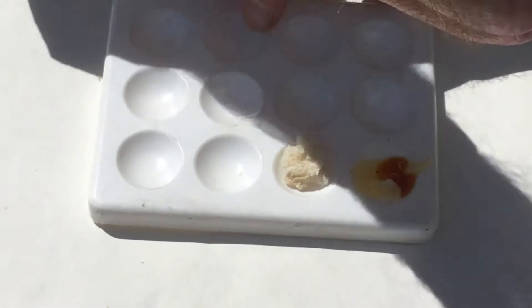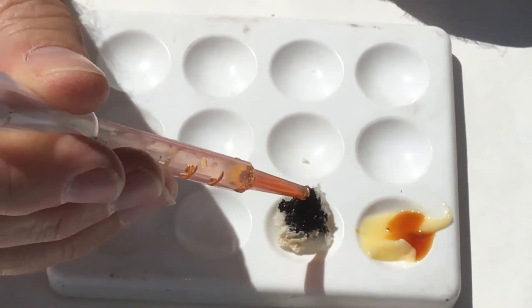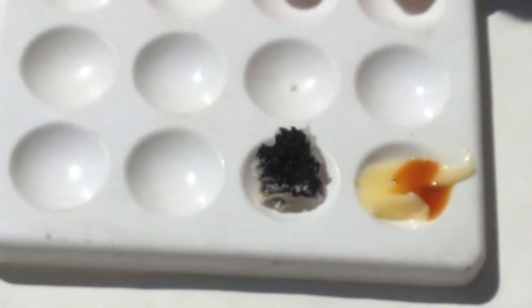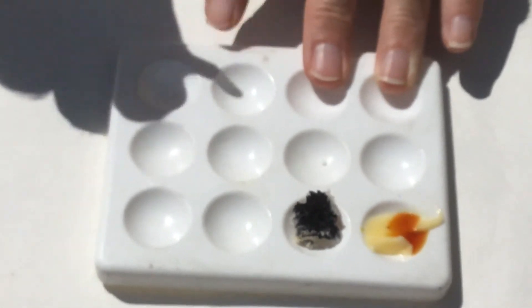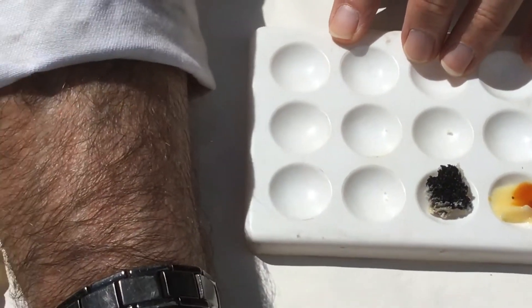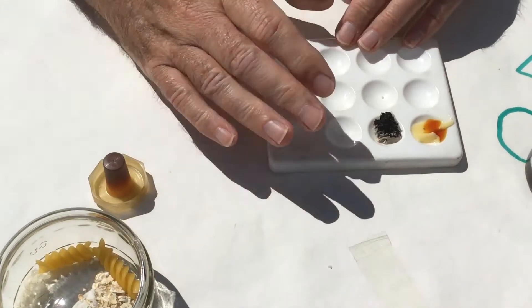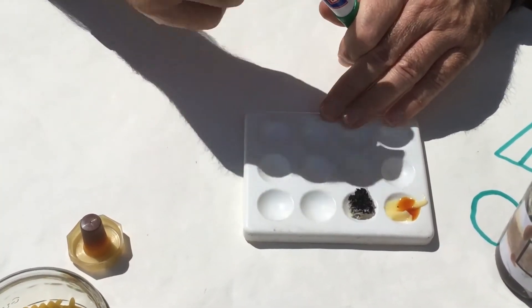Let's have a look at the bread. We eat a lot of bread. Let's put the iodine on the bread — yes or no? Fairly obvious. Yes — it's gone really black. So bread is part of our diet that we use to give us energy, and it contains starch.